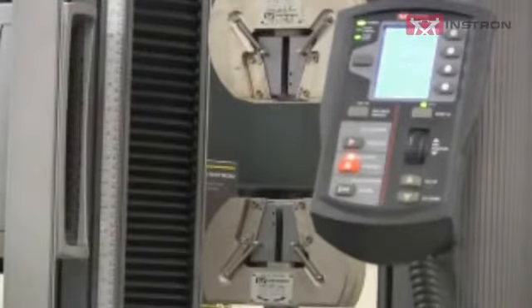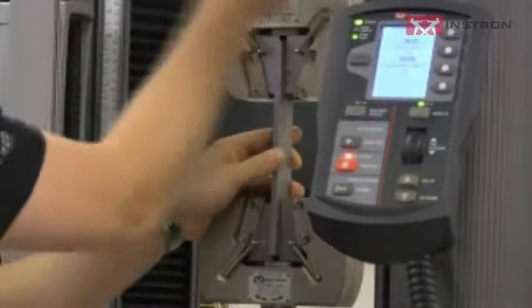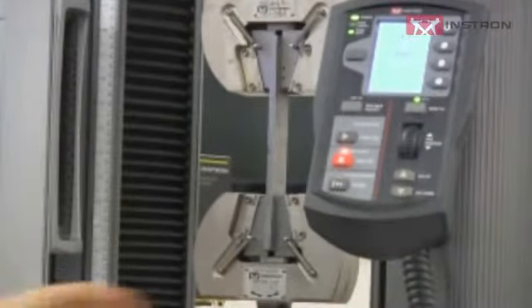What we're going to do here is use a rigid material, in this case just a piece of steel, so we know it's straight and flat. We load it into our grips, and I've got a test set up to run it up to 500 pounds.